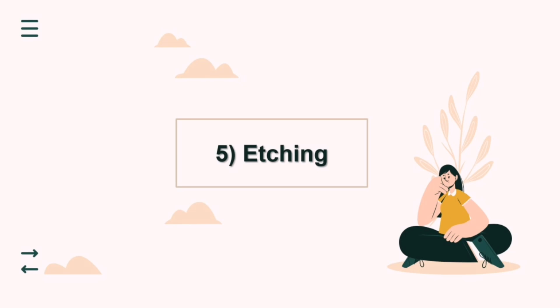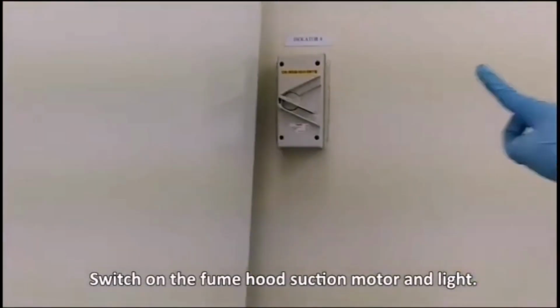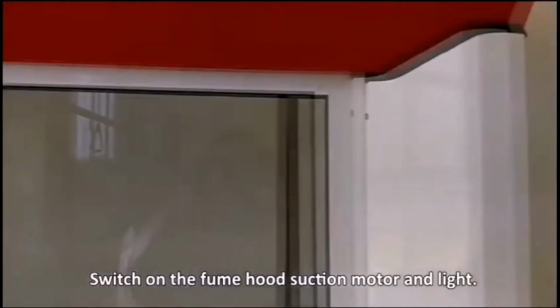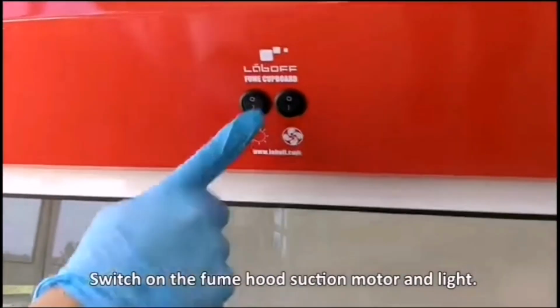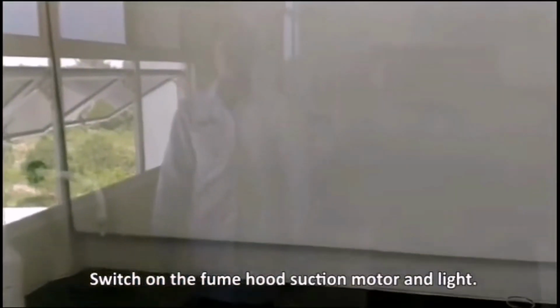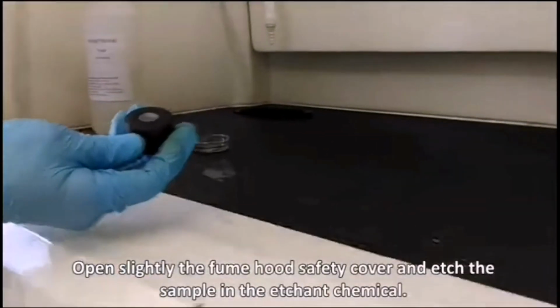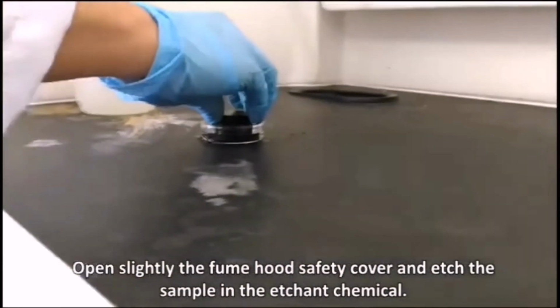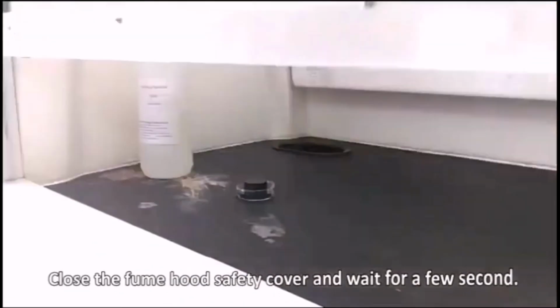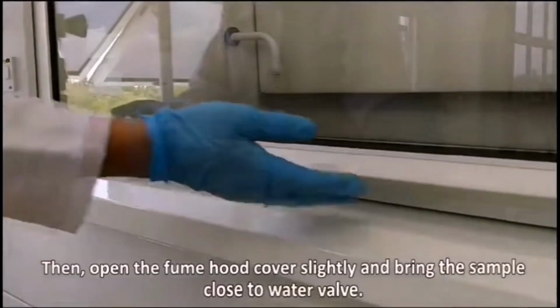The last one is etching. For etching, I use a video to show the process. We place it in a chemical, a very high concentration chemical, for a few seconds, in a fume hood for safety.